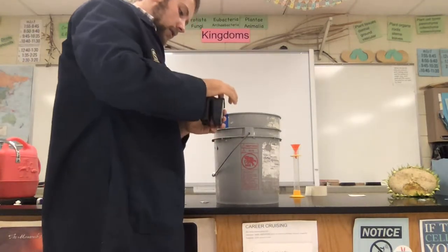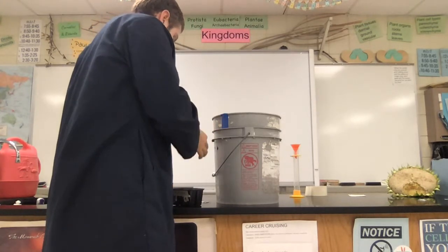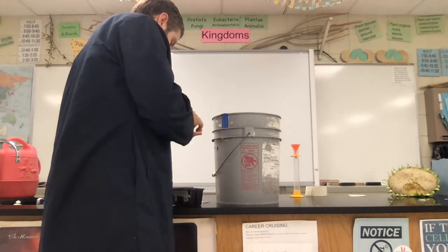So go one in here. You get a couple more. I'm going to need eight total. One in here. I need six more.